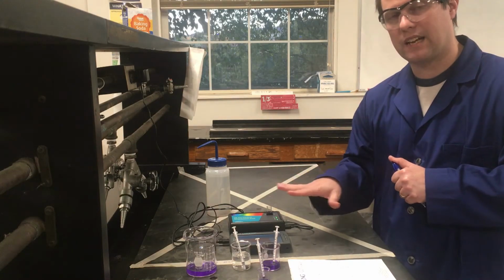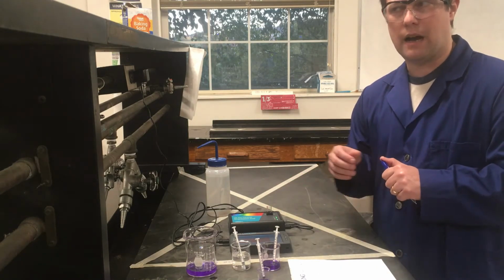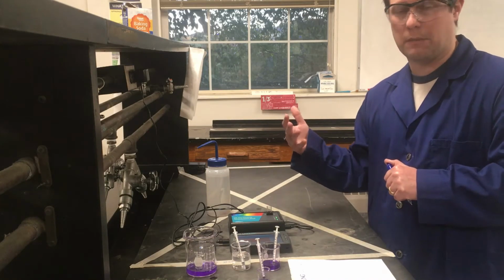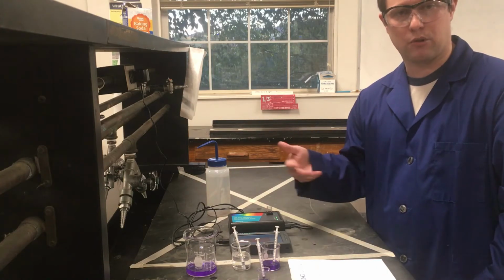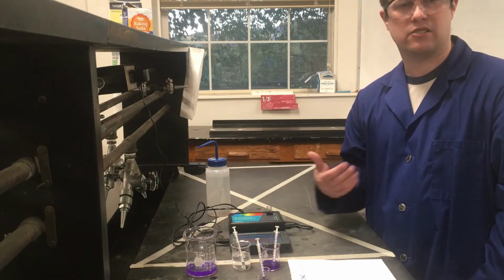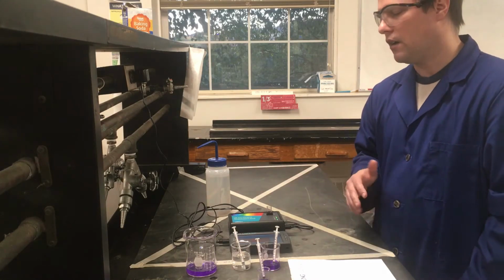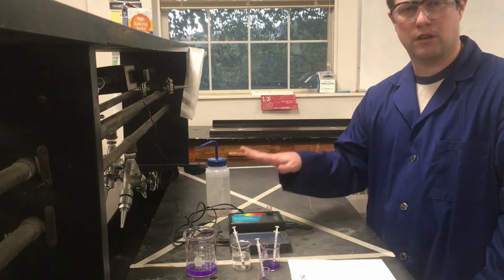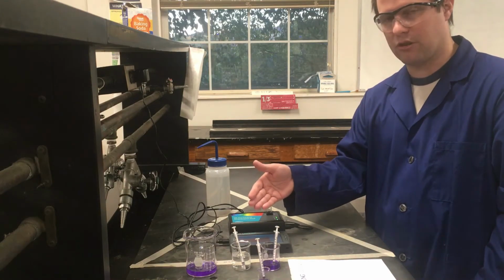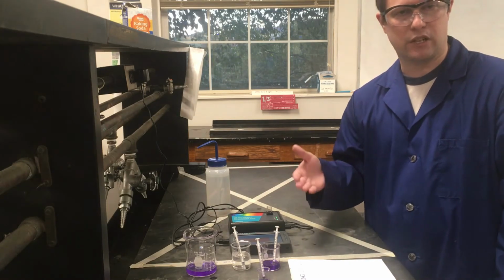Because the purpose of this data is that by measuring the absorbance at different concentrations, I'm generating what's called a calibration curve, so that when I do the last part of the experiment, which is an actual chemical reaction between the crystal violet and sodium hydroxide, I can monitor the concentration of the crystal violet over time. That's what I want to be able to do at the end of everything. This calibration curve helps me convert absorbance to concentration, so that when I make these same measurements during my reaction, I can convert all of those absorbance values to concentrations. And now I have a way to look at how my concentration is changing with time.